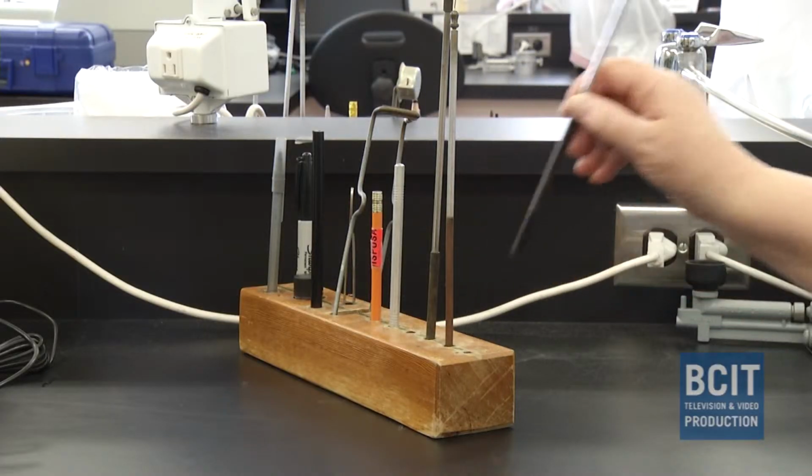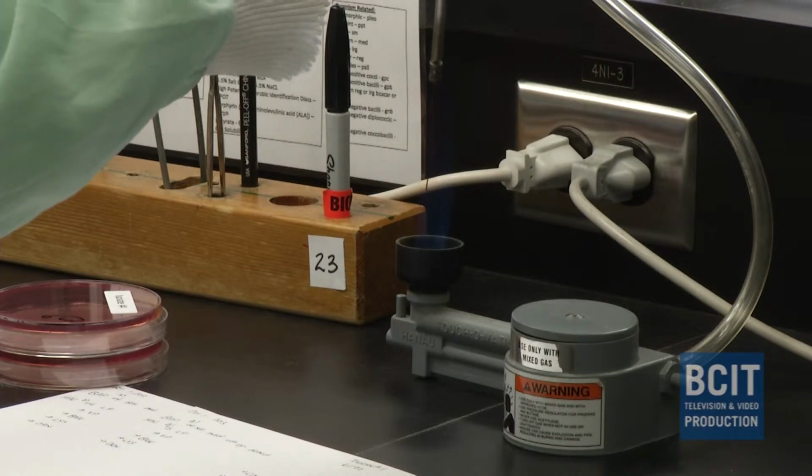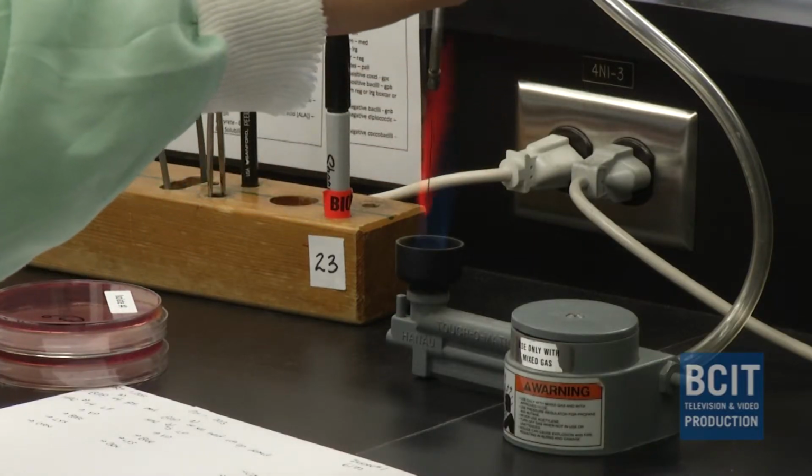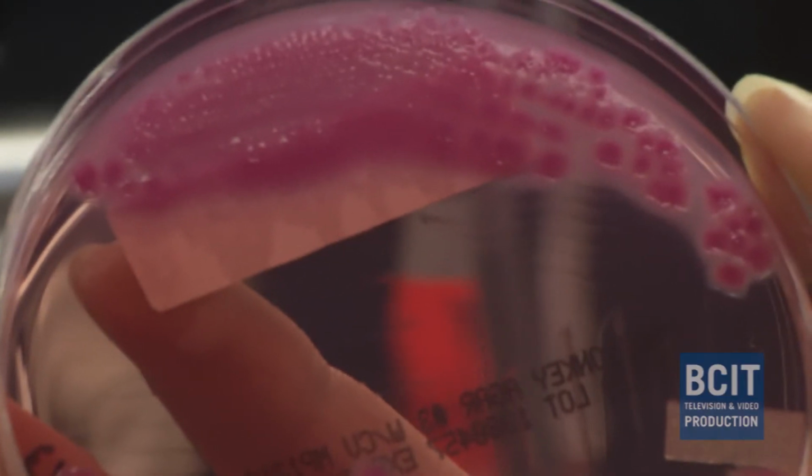So that involves a concept called Aseptic Technique, where we make sure that we don't introduce anything else into the culture. So the sterilizing of the tools, you saw them flaming. We use nothing but sterile equipment. All the liquids that we use are all sterilized. So it's a two-step process. We protect ourselves and we protect the culture.